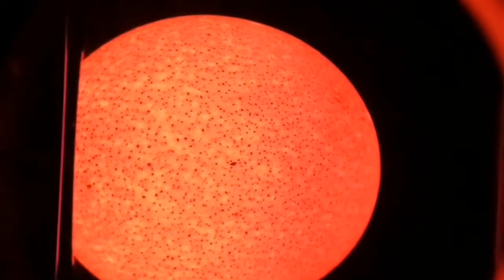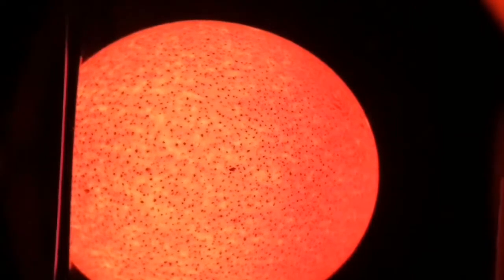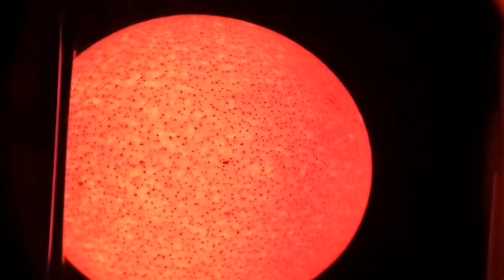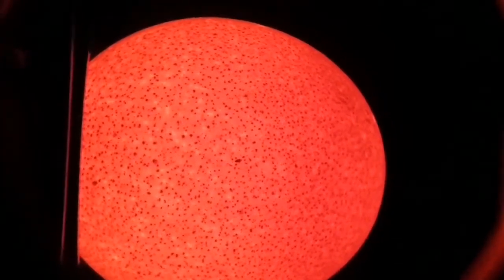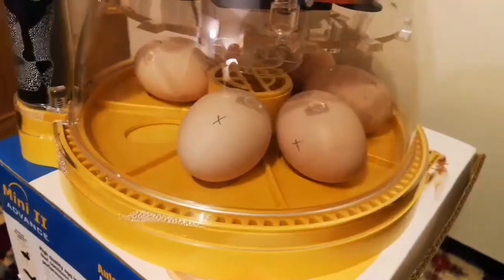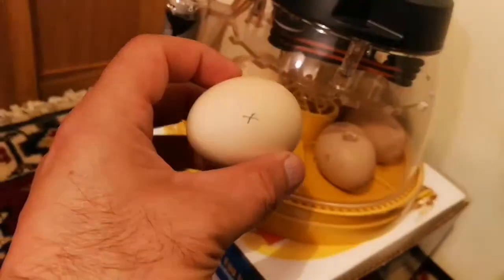This is the first time you can see such a thing in the history of YouTube! I'm tempted now to put one of those fertilized eggs in. Should we? Yeah, why not. This egg we are looking at now has not been fertilized — it's just the egg that we eat. So we are going to put one of those fertilized eggs that we have in the incubator. These are the fertilized eggs — let us put one of these here.